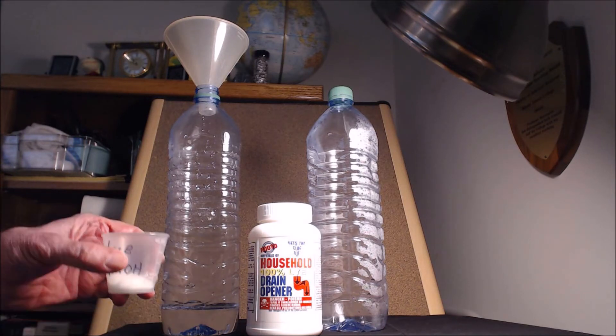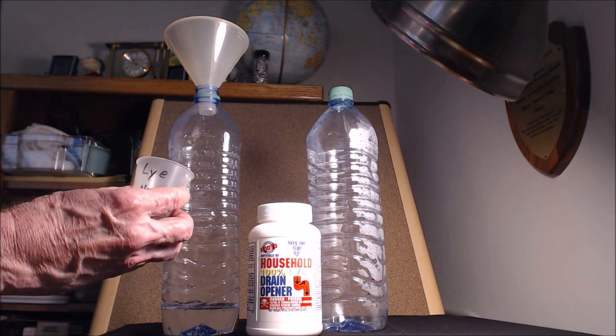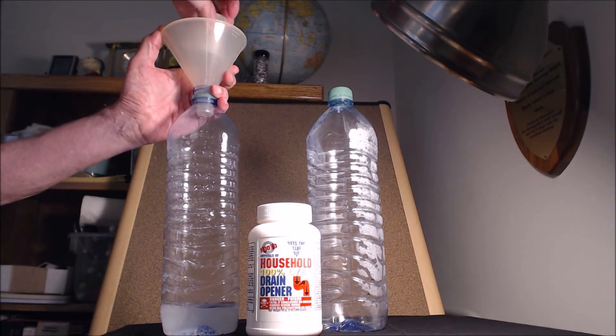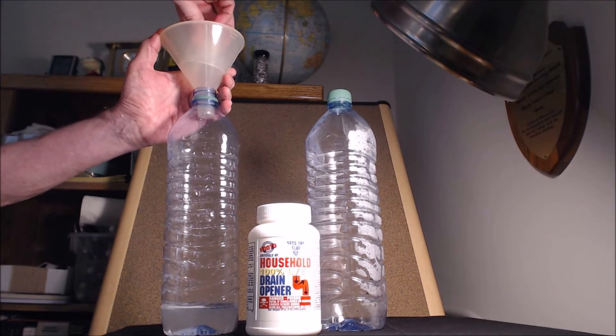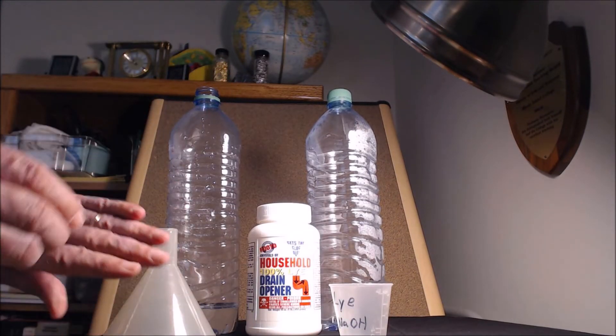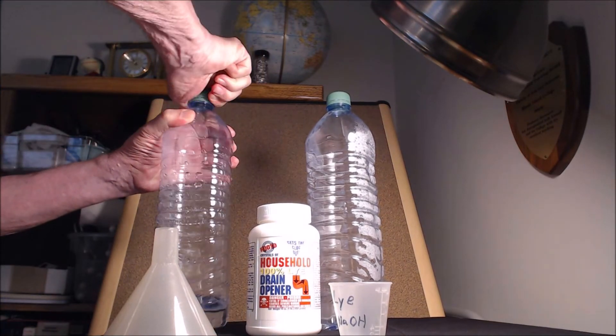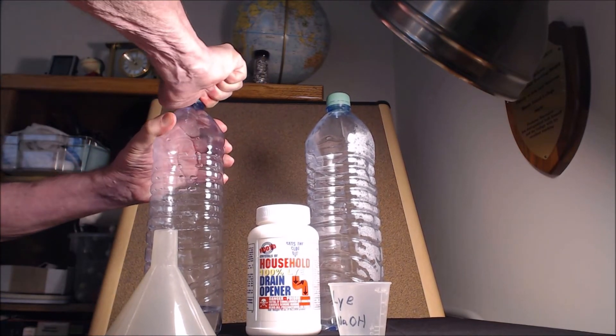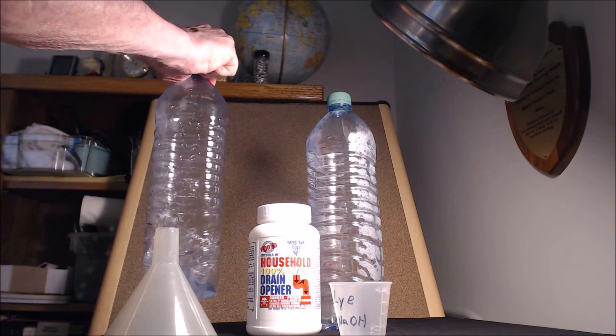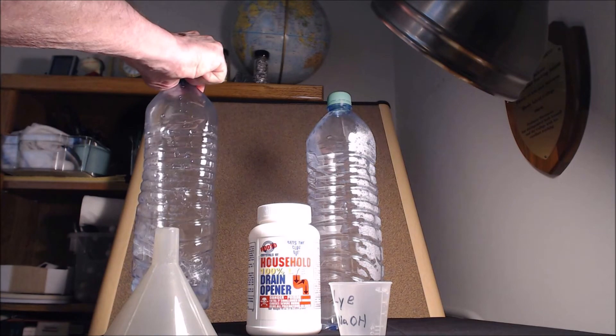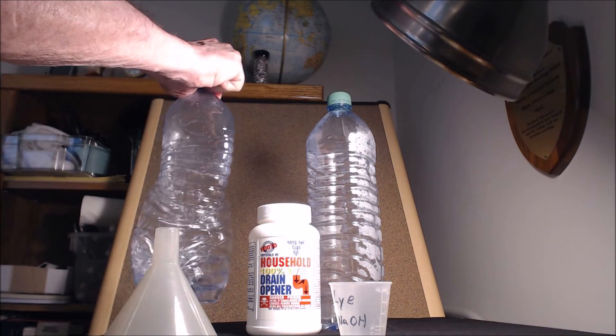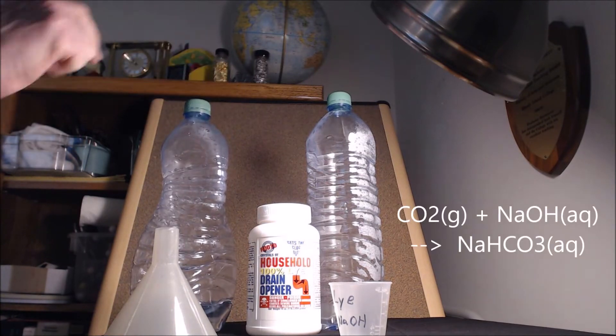I have an excess of the sodium hydroxide. I'm going to pour it in. Now because you have an excess, when you clean this up be careful with your hands. I'm going to put the cap on real tight and dissolve the sodium hydroxide. We have pretty much an equal molar amount. Look at this, how spectacular that is.